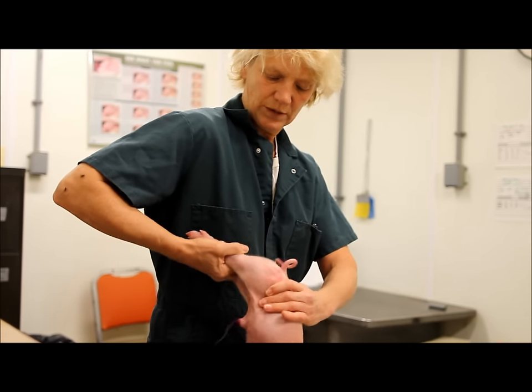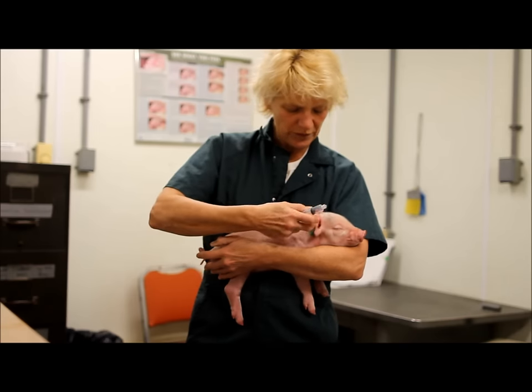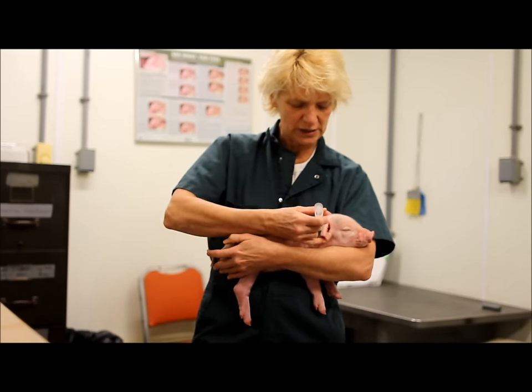Or even putting your finger in between. Generally, one pig at a time. We've put this little green area here to show you that this is the area where the injection goes in.